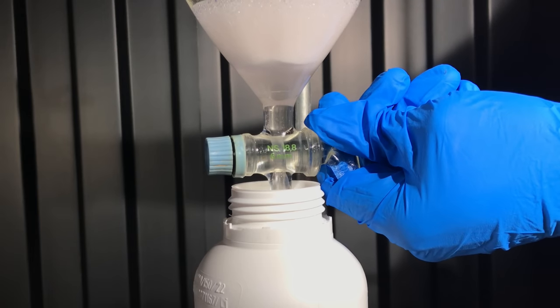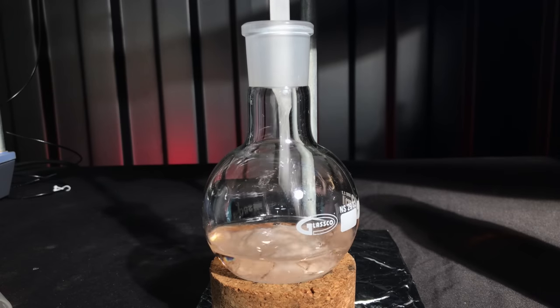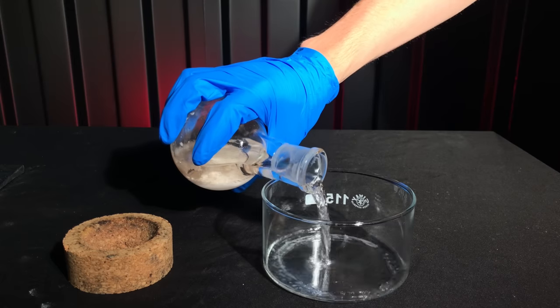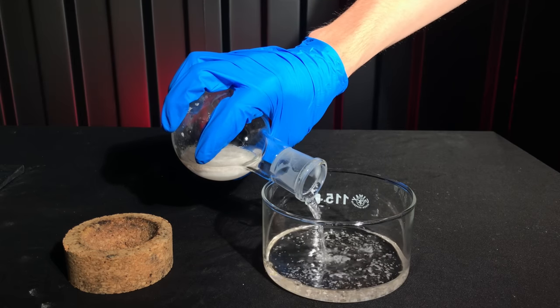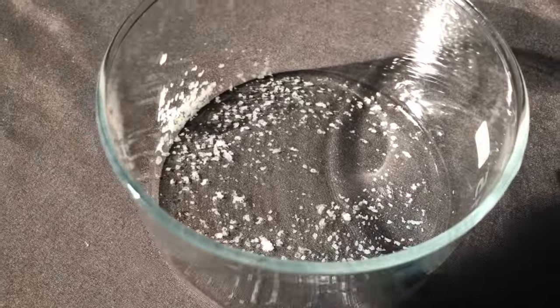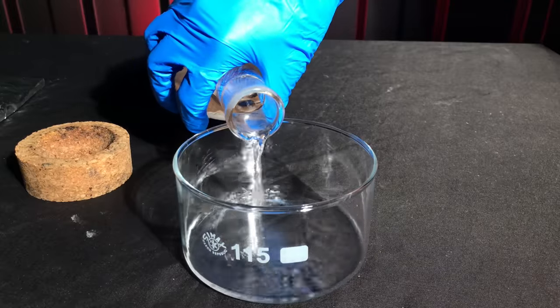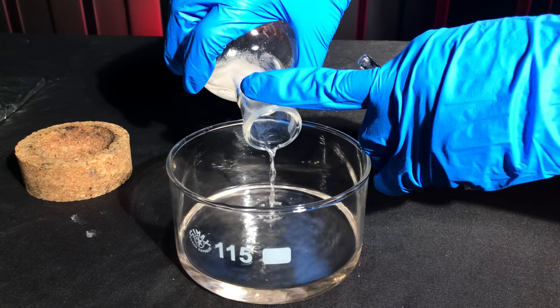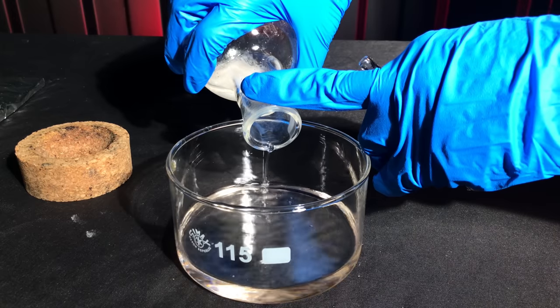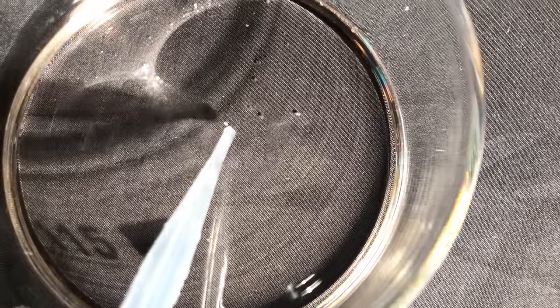As ether and toluene are lighter than the aqueous phase, I had to drain the bottom layer into a bottle before collecting the good stuff. In the end we were left with this strange looking stuff. The first time the top layer was decanted, a lot of strange white substance came over, so I put it back, cleaned the dish and tried again. This time it miraculously worked. I guess it was a weird toluene, ether, water, and enzyme mix. These small spots you can see floating around were sucked up using a pipette.